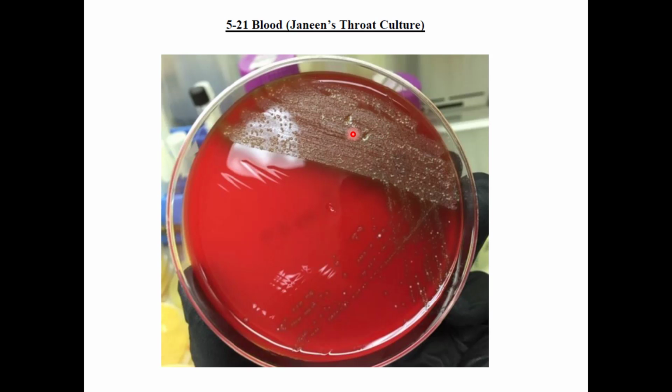Okay, and then as we look against the light, because that's the part you can't see from this picture, we would try to see if there was more hemolysis around that cut, because that means the bacteria got inoculated inside of the cut, once you make the cut after you already streaked the bacteria all over quadrant number 1.